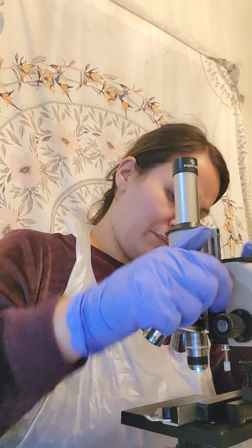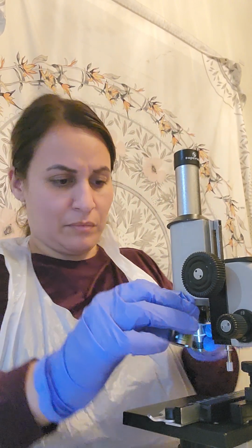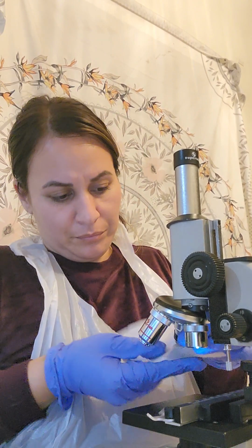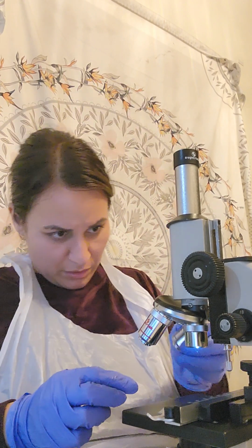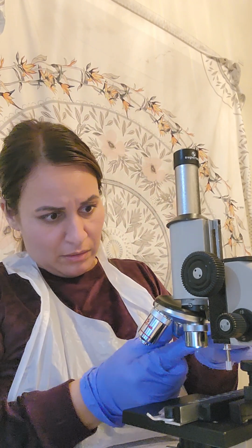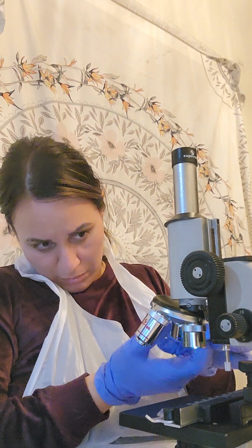Grayish again. I have two more here. Put the medium back in. I don't know what's going on with my small one, why it doesn't want to come out, but I'll have to worry about that later.